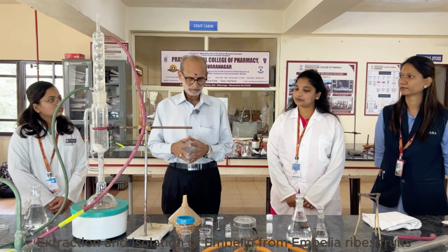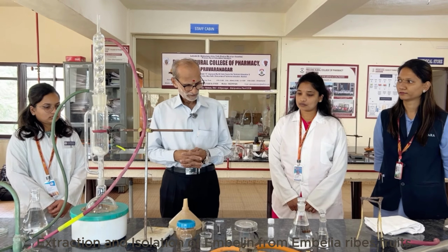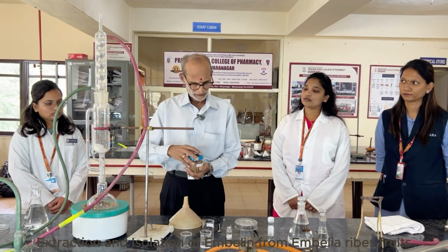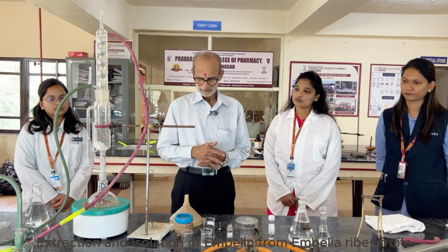All quinones are colored compounds, whether it is a benzoquinone, naphthoquinone, or the anthraquinone. And this is the powder actually of Embelia ribes, and Embelia ribes is normally used in the traditional system, or, I'll put it, folklore.